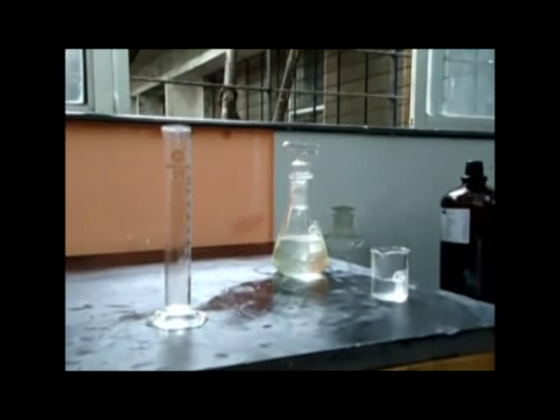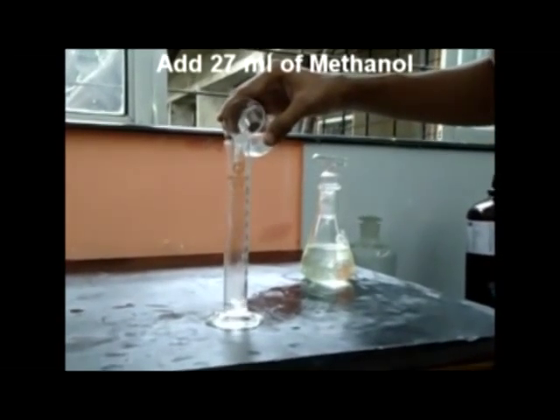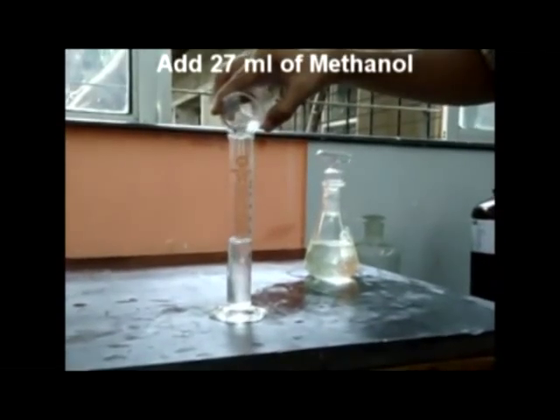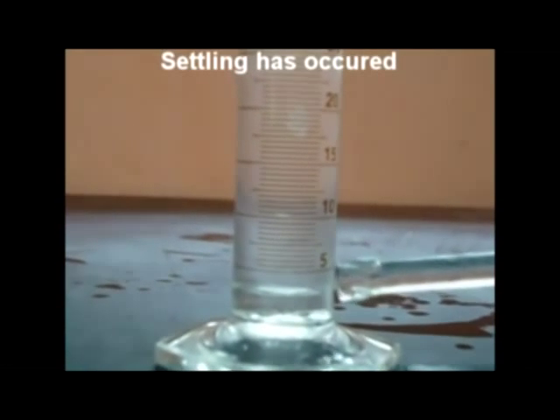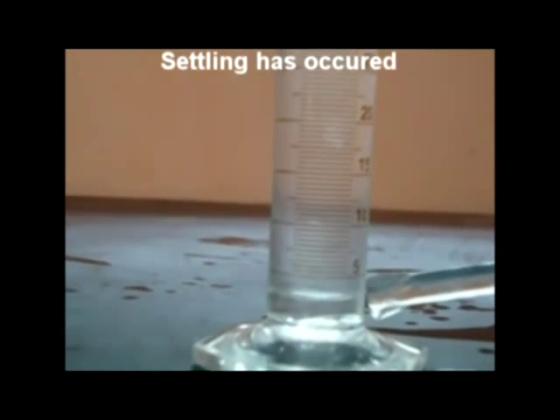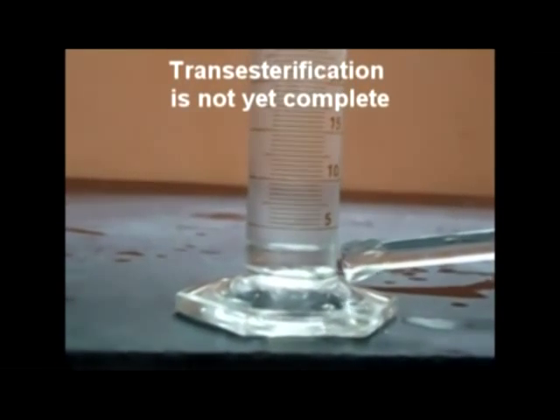The 3:27 test is used to determine if the transesterification reaction is complete. Take 27 ml of methanol in a measuring cylinder, then pipette out 3 ml of sample and put it into the cylinder. Stir for some time and leave the mixture for 5–10 minutes. If settling occurs showing two layers — one of unreacted triglyceride and one of methanol — this indicates that transesterification is not yet complete.